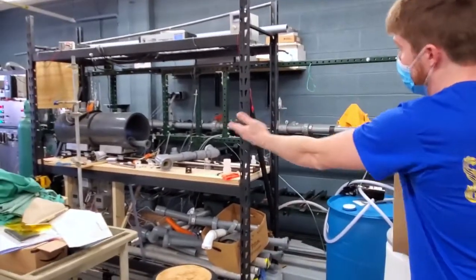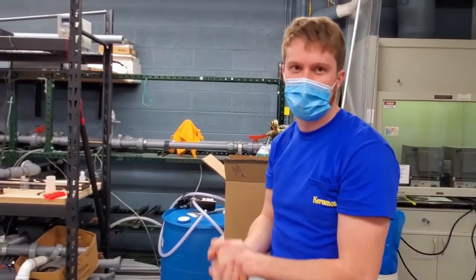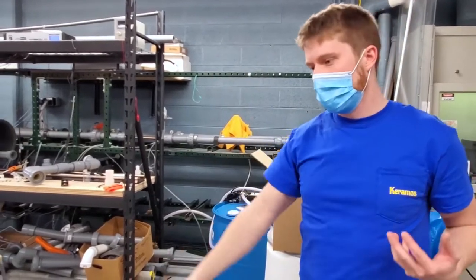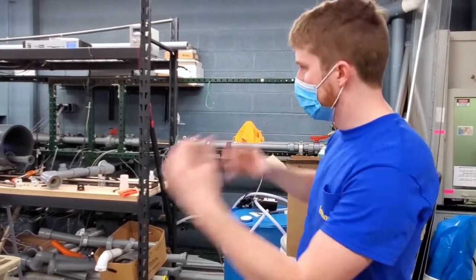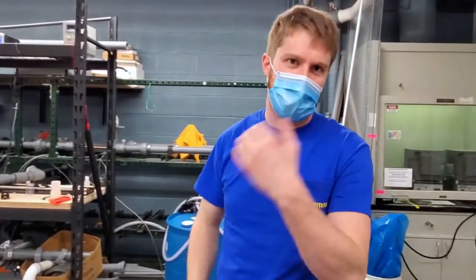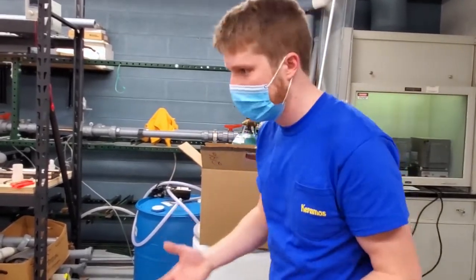Here, this is actually a corrosion lab setup. This was designed by one of our senior design teams studying the effect of corrosion and different types of corrosion that involve corrosive liquids, or liquid materials eroding away pipes and all that. This is obviously very important for the Navy, anyone that deals with ships and seawater, figuring out why and how stuff corrodes so we can design it such that it doesn't corrode as fast.